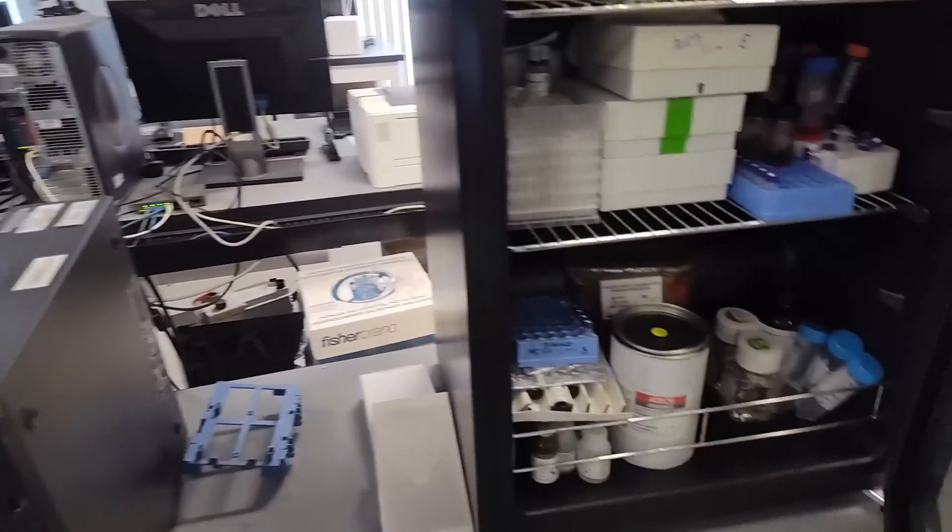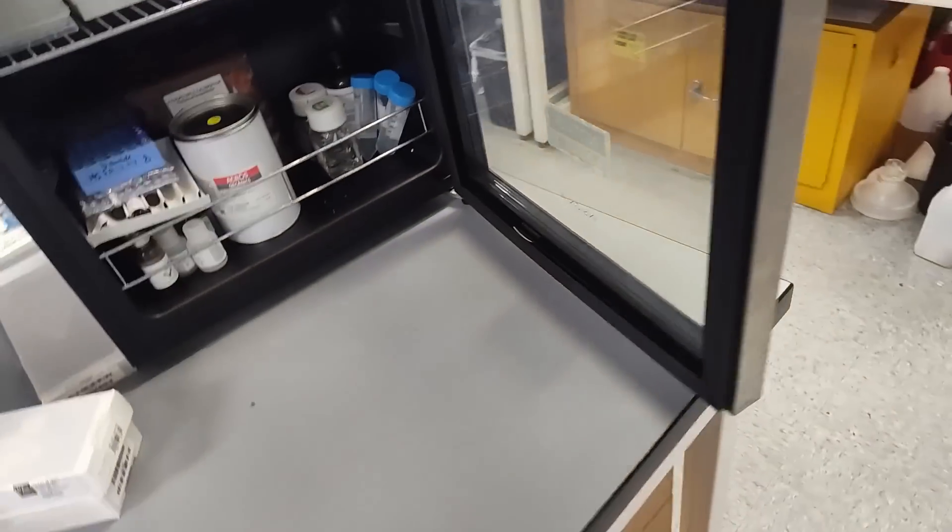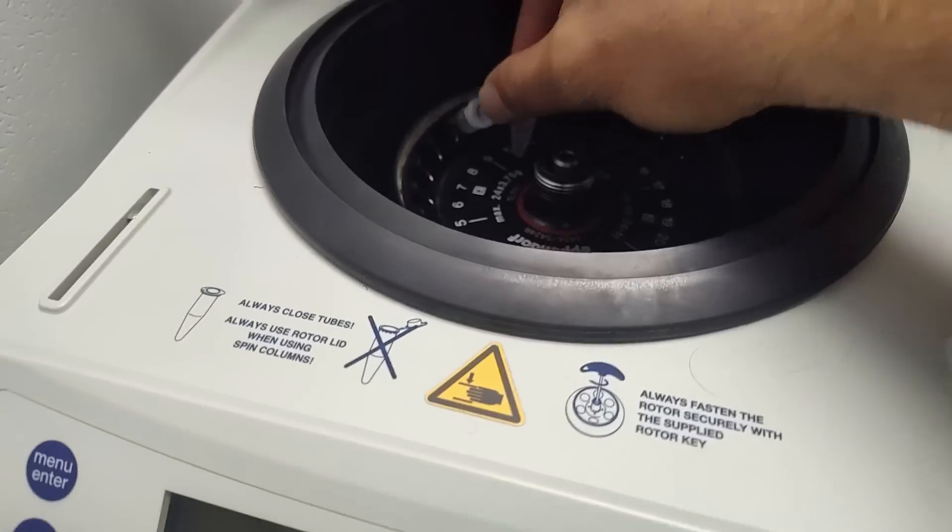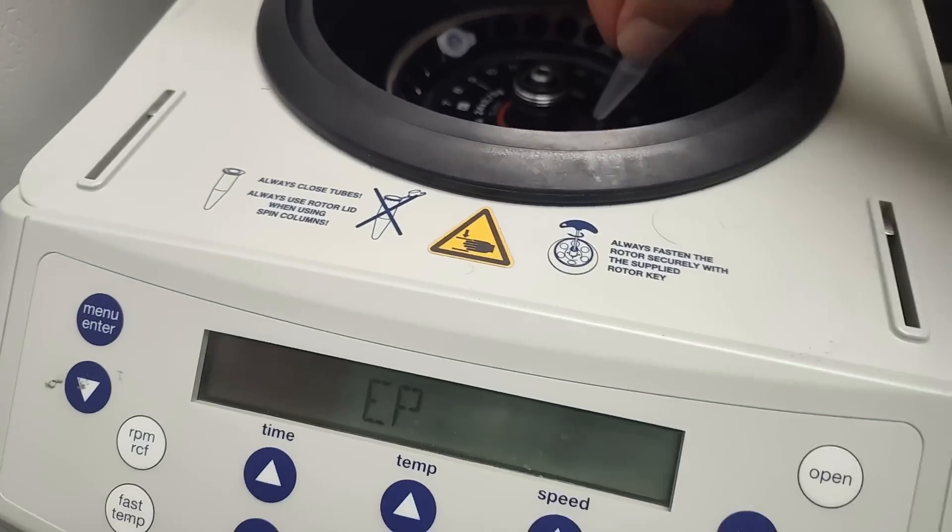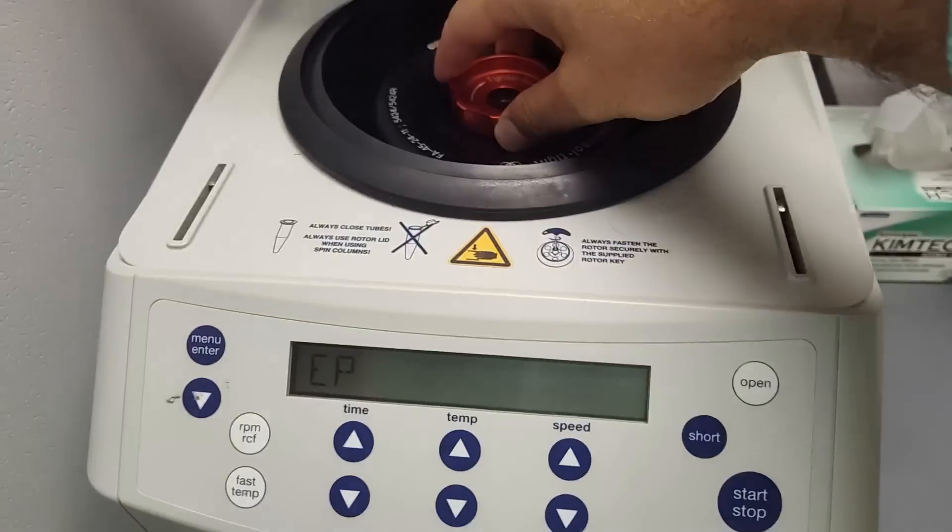And then these we're going to mix and refrigerate for about 15 to 20 minutes. They do look pretty similar. I still think I can see the difference. I think the C is on the left. It's definitely been long enough. Let's get these out of the fridge. Do they look any different? No. Let's go spin them back out.